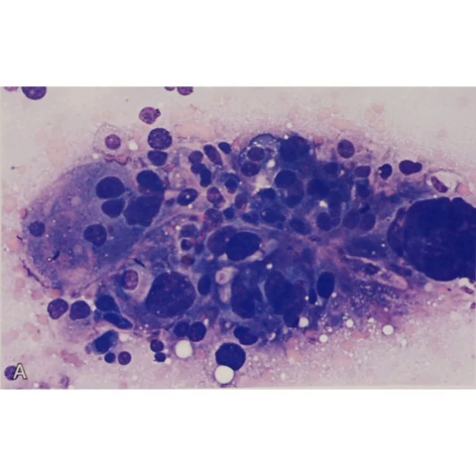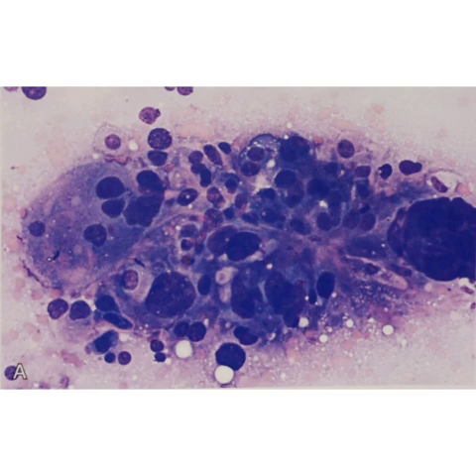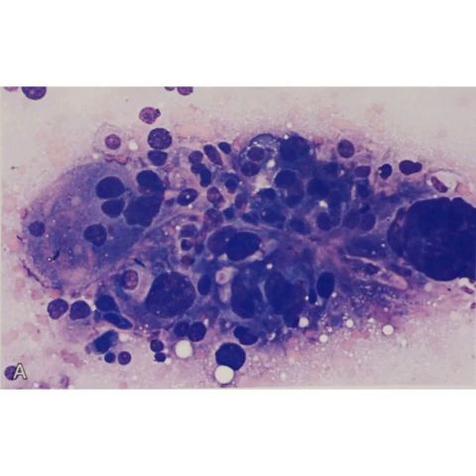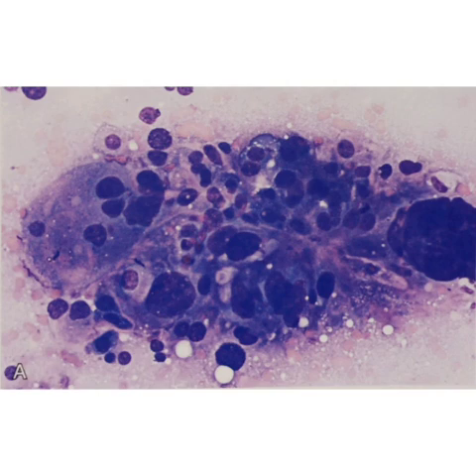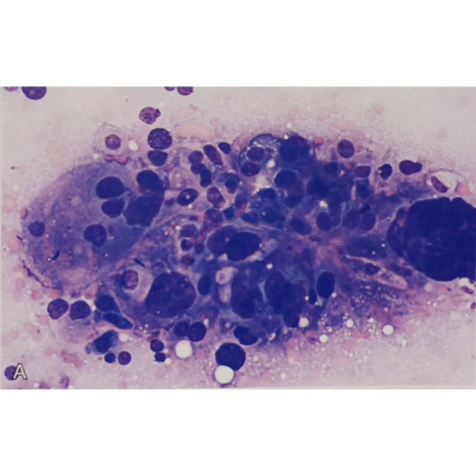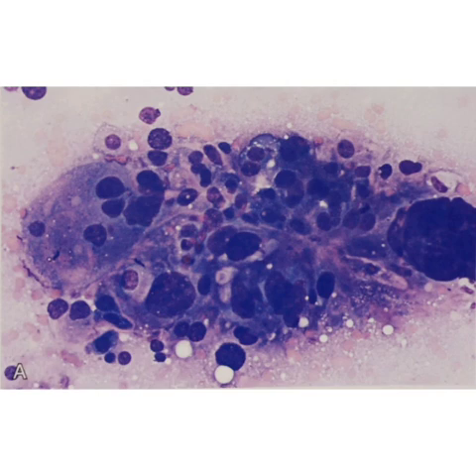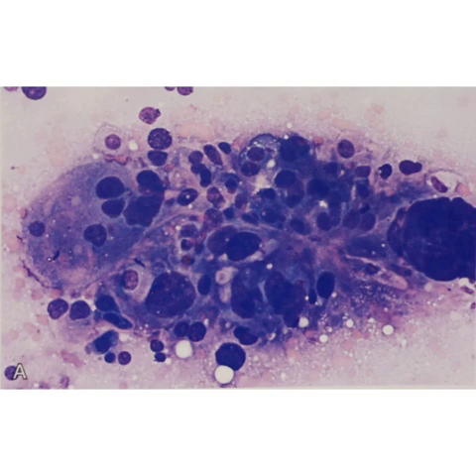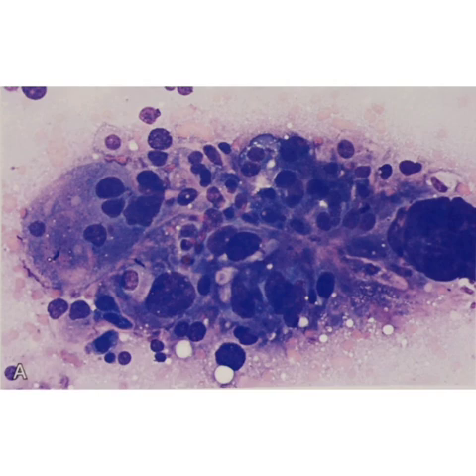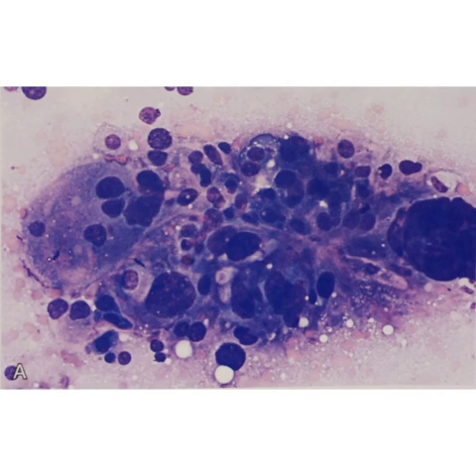Whereas in fibroadenoma or benign breast disease, you will see cohesive clusters. Here, you can appreciate the poorly cohesive clusters of cells with enlarged cells of variable sizes — the cells are not uniform in size.